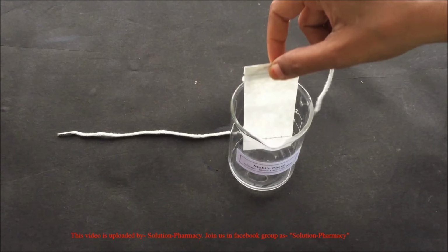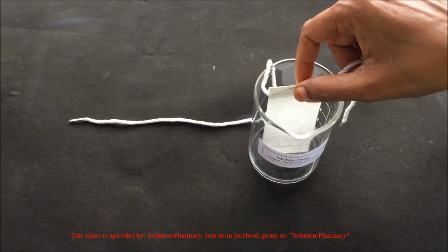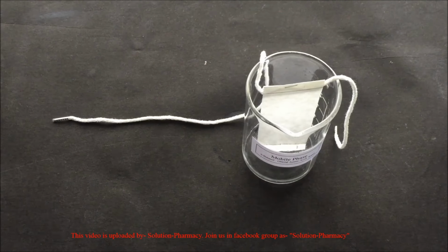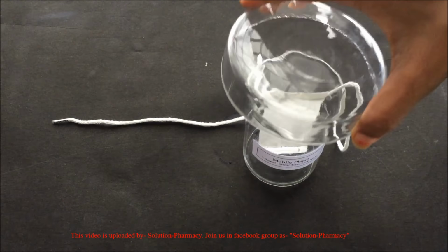Immerse the filter paper vertically in the center of the beaker. Note that the level of mobile phase in the beaker should be such that the spots should not dip into the solvent. Cover the beaker with the petri dish and then allow the mobile phase to move over the filter paper up to the end line through capillary action.